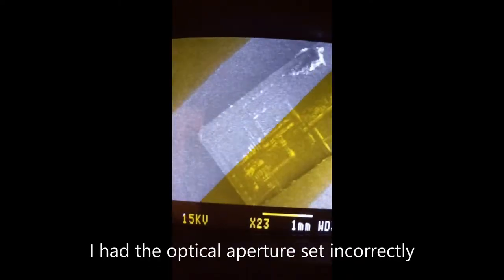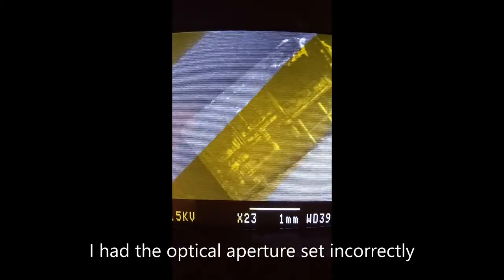Alright, so here is the chip. And it is taking me about 10 minutes or so to bring this into focus and get things going. At low magnification, there is quite a bit of noise in the image. I can reduce some of the contrast and take some of the noise out.